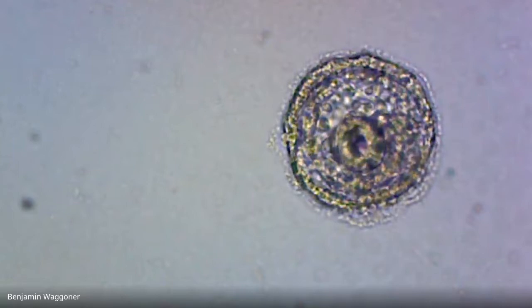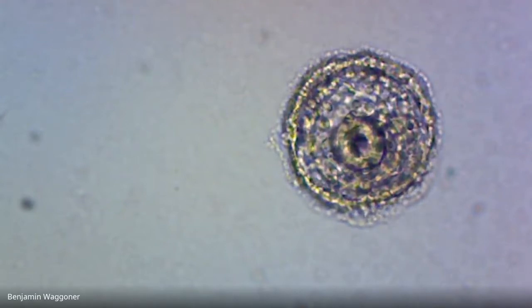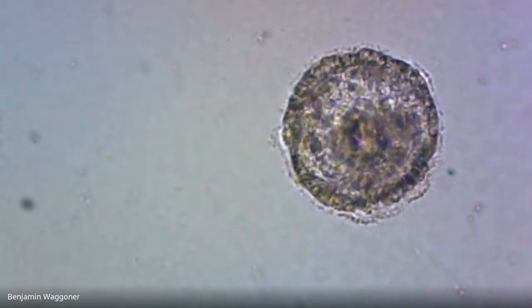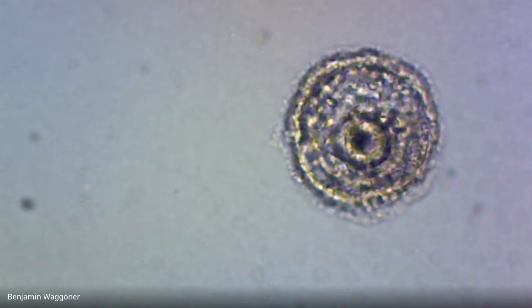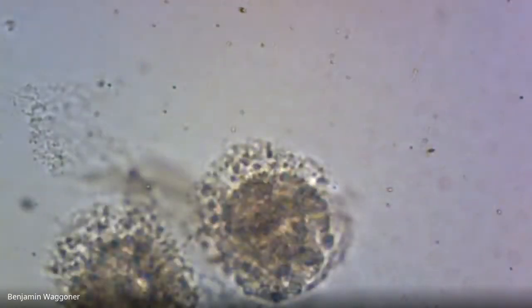It's interesting. That's not terribly different from the ones I was filming yesterday. So at the very least, development doesn't seem to have gone on much farther in this one than it did, I guess, yesterday afternoon. There's another one that just looks like a mess. There's two more that are messes.